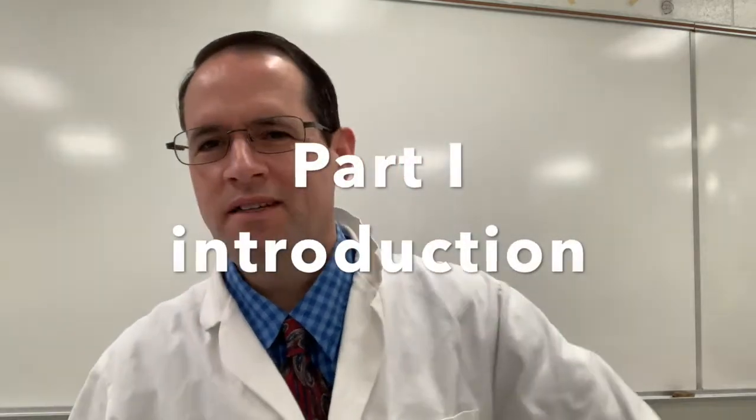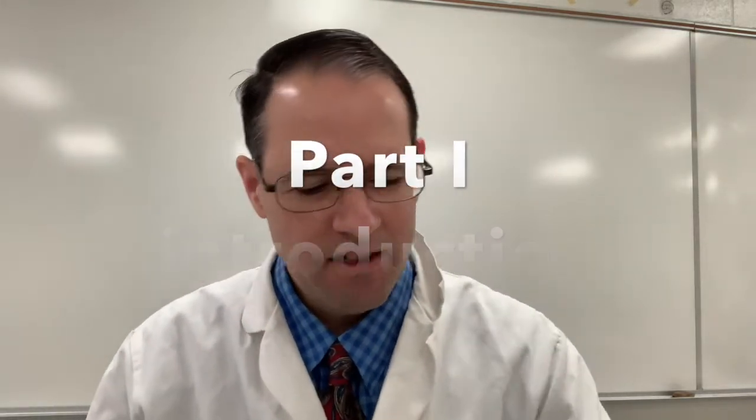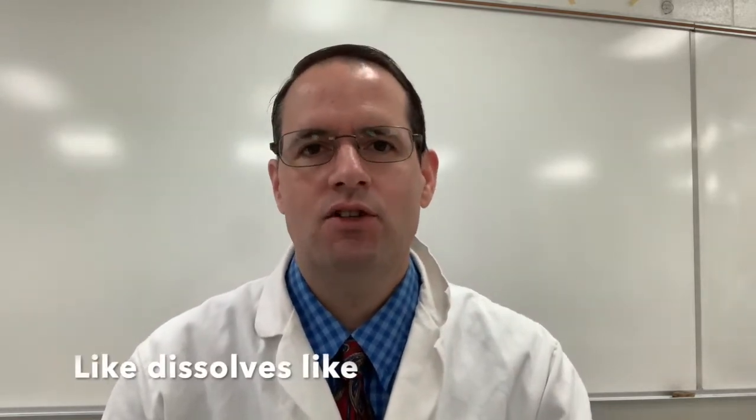Hello, in part one, we are going to be testing the solubility of different substances in water and trichloroethane. And I want to try to hold the phone here and take you through the different models and discuss the properties of these different things. Remember again, the motto for this lab, if you will, is like dissolves like.